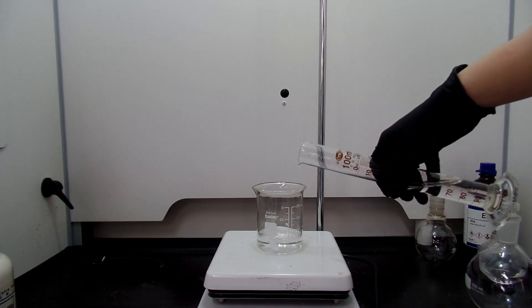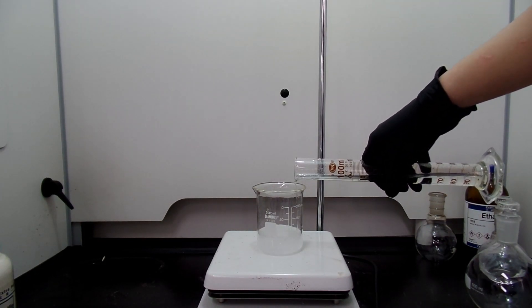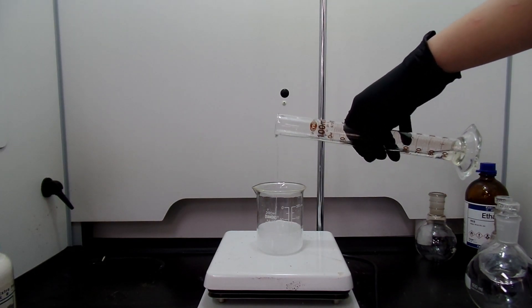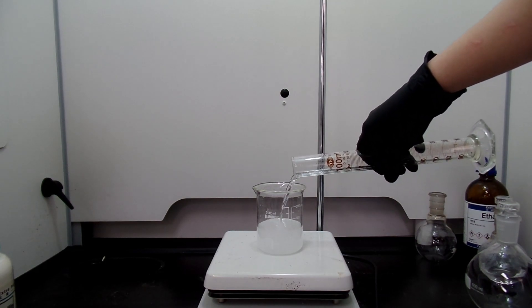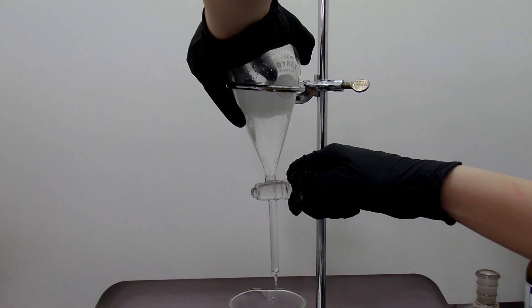For the reaction, I get 40 mL of benzaldehyde. I wash it with some sodium bicarbonate solution to destroy benzoic acid and use a separatory funnel to separate.